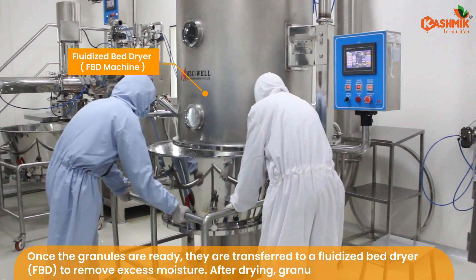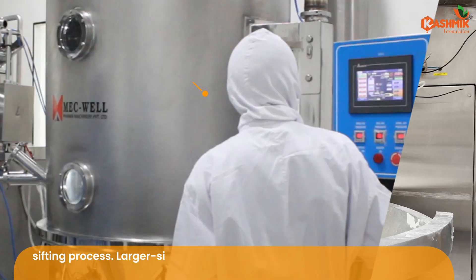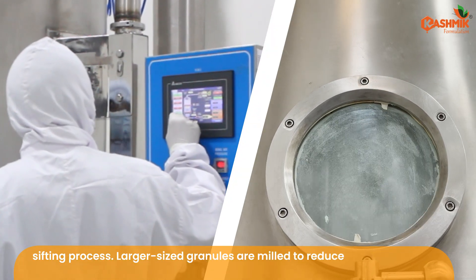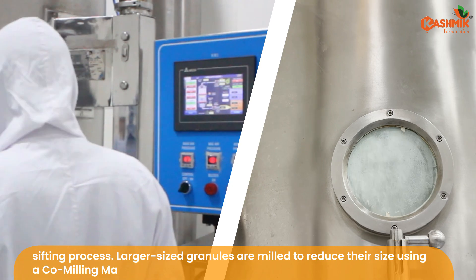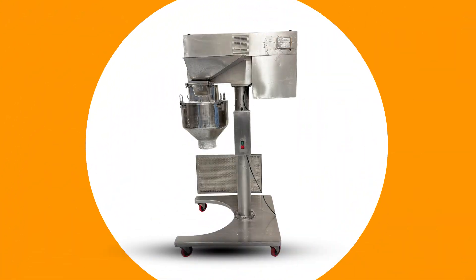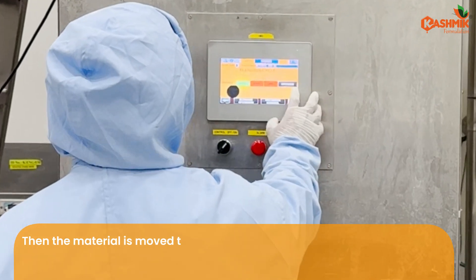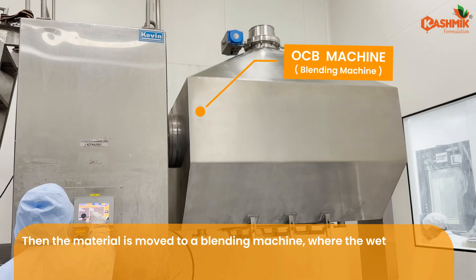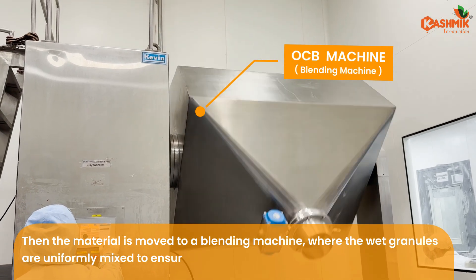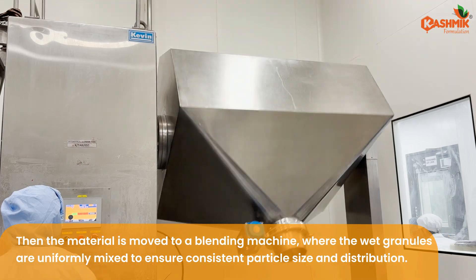After drying, granules go through the sifting process. Larger-sized granules are milled to reduce their size using a co-milling machine. Then the material is moved to a blending machine, where the wet granules are uniformly mixed to ensure consistent particle size and distribution.